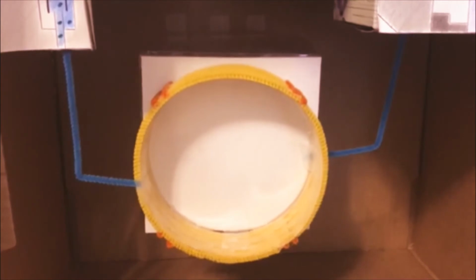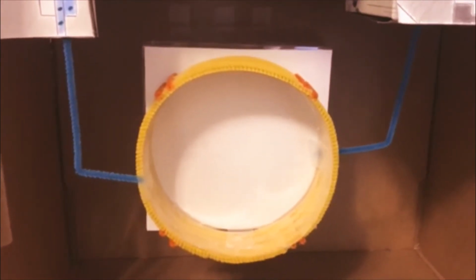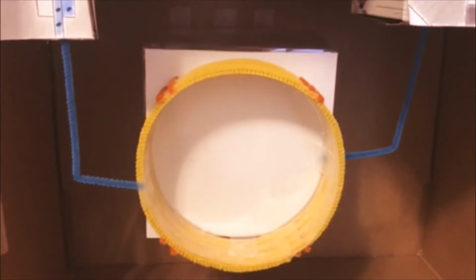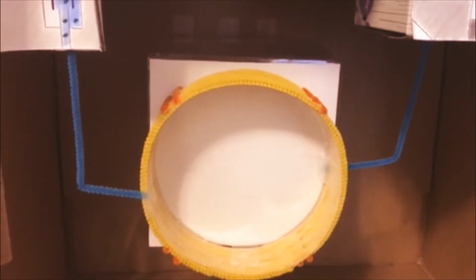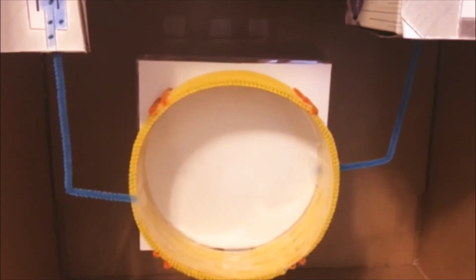The capillary tube is very thin, which allows the most interaction between the walls of the capillary tube and the sample molecules. The polarity of the capillary tube can be changed by changing what the walls of the capillary tube are coated with, whether it is coated with hydrophobic or hydrophilic molecules. The polarity of the walls of the capillary tube determines how the sample molecules are effectively separated.